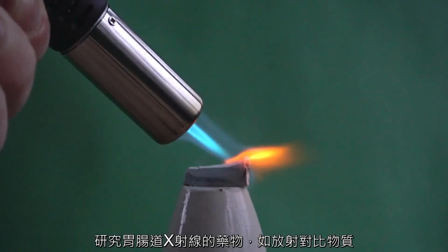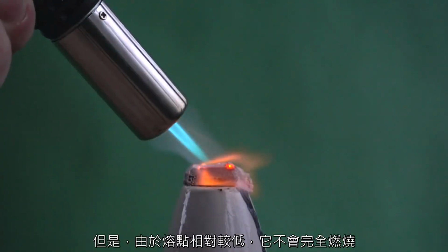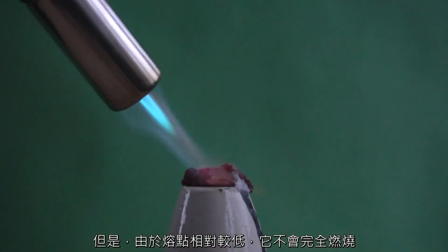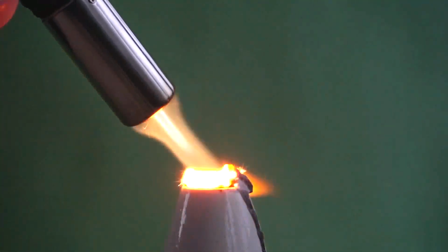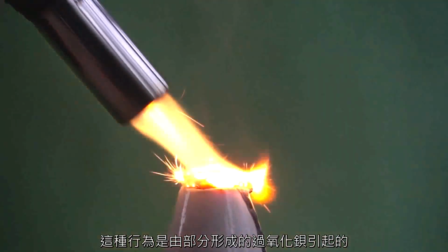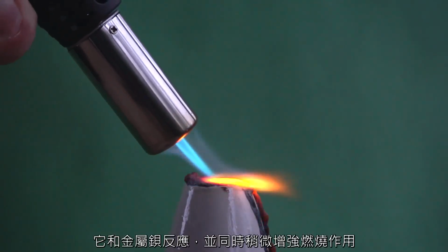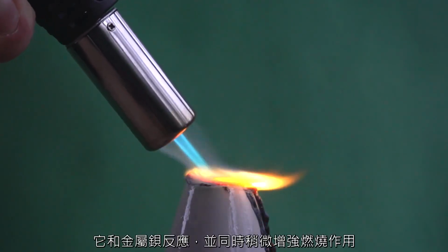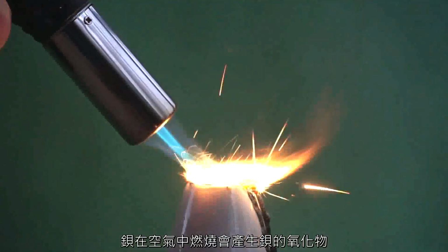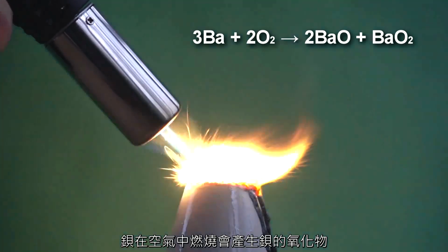Barium metal on its own burns quite well in air. However, due to the relatively low melting temperature, it does not burn completely and burns with pulsating action. This behavior is caused by the partially formed peroxide of barium, which reacts with the metal barium, and at that time the combustion is briefly enhanced. As a result of barium burning in the air, we get barium oxide.